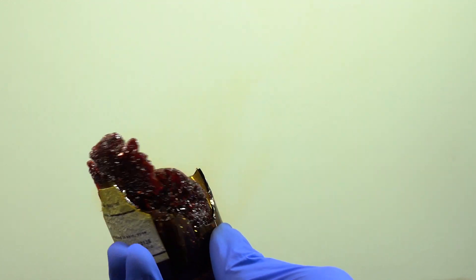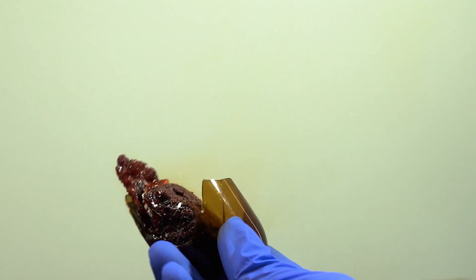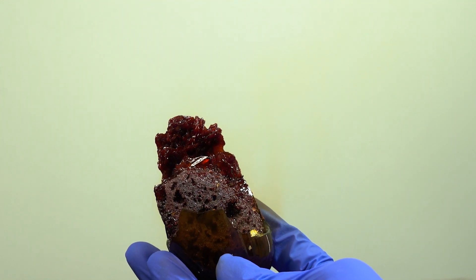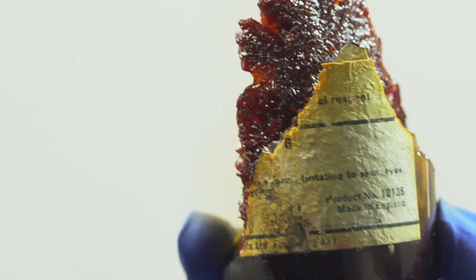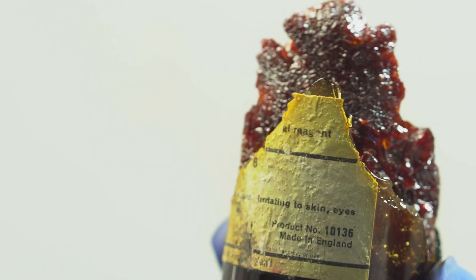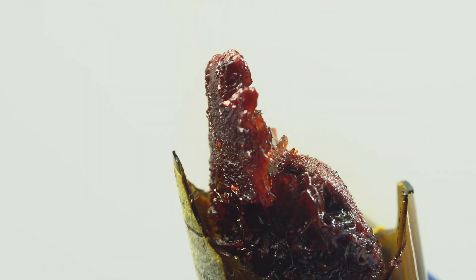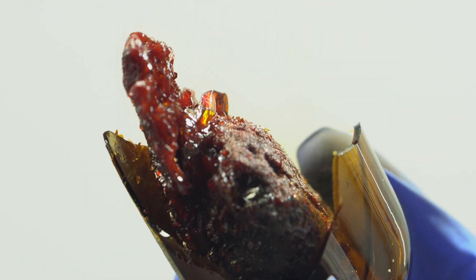This substance is extremely volatile. You can see its dark orange fumes on a lighter grey background. We don't have much time, because iodine trichloride is very sensitive to air humidity, so let's enjoy this beauty until its crystals didn't decay in the air.